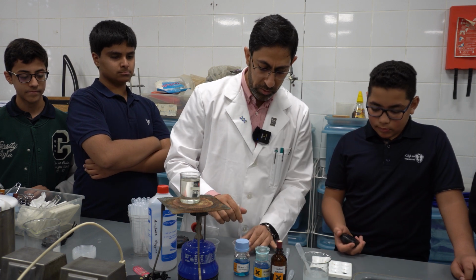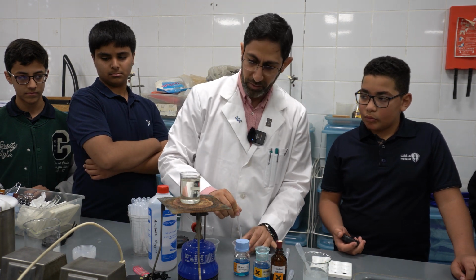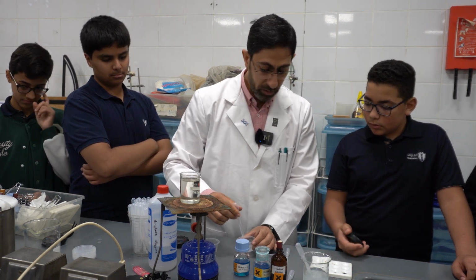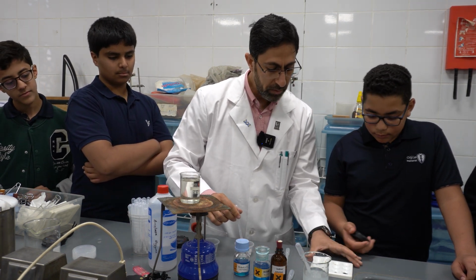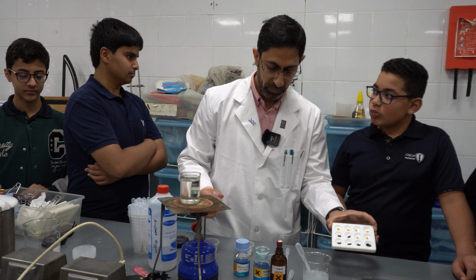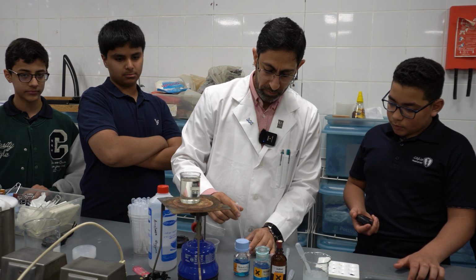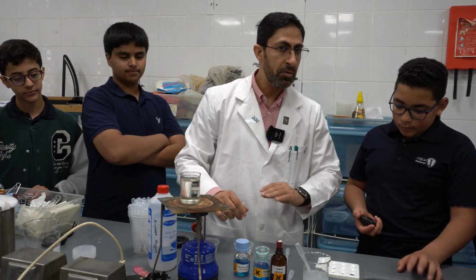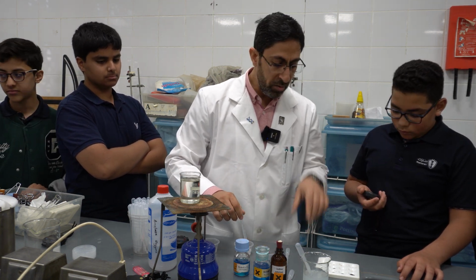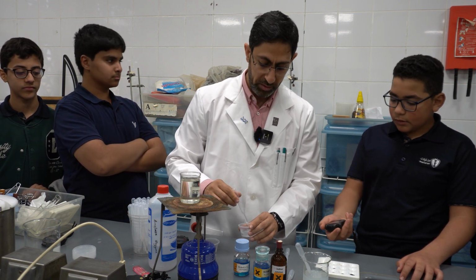Yesterday we had the thermostatically controlled water bath, but now it's being used by the biolab. So we are using an alternative way for the Benedict reagent. Another 30 seconds and one drop. Yes, it is lighter. Exactly. So we are on the right track. Afterwards, when there is no color change for the iodine, this indicates that there is no starch remaining, and all that remains is the disaccharide maltose. So we're going to use the Benedict reagent to test for its presence.